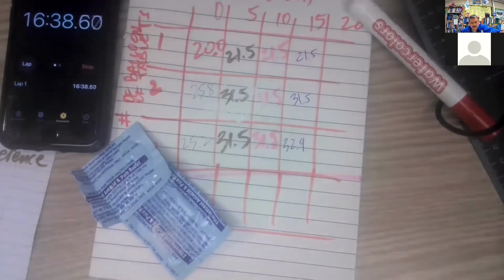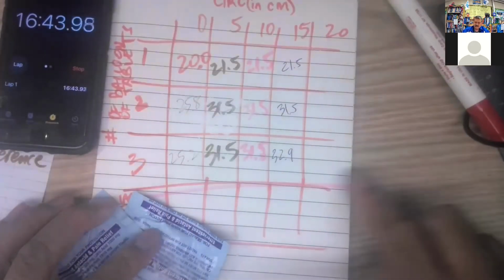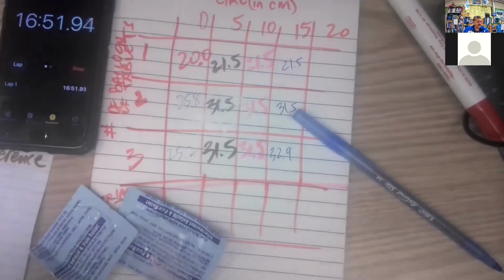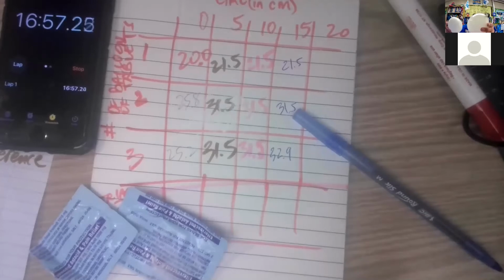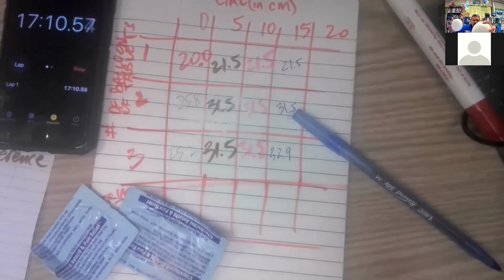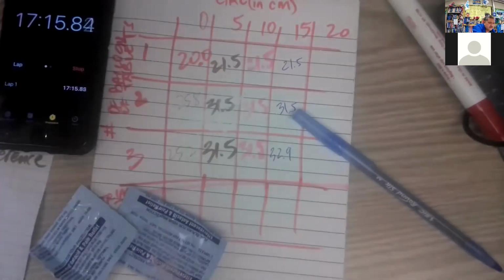Okay, so we'll take another measurement at 20. Be interesting to see if that third one goes any higher than that. It didn't move between 5 and 10, but it did get just a little bit bigger now. You look at them on the small screen, they look about the same to me, but this one is a little not quite spherical, right? And maybe it's just the bump that did it. I don't know.